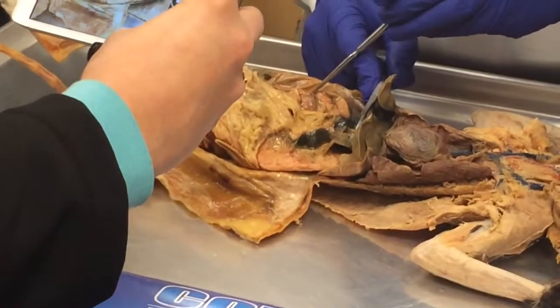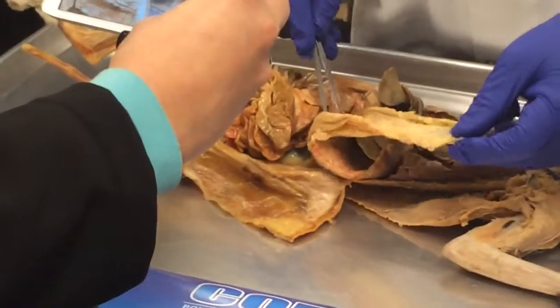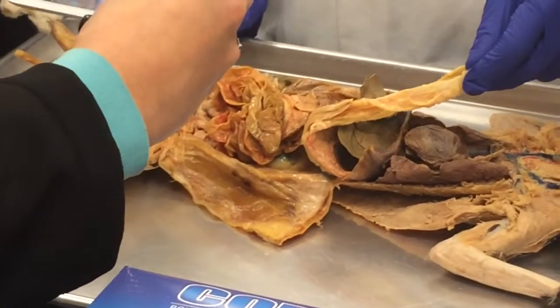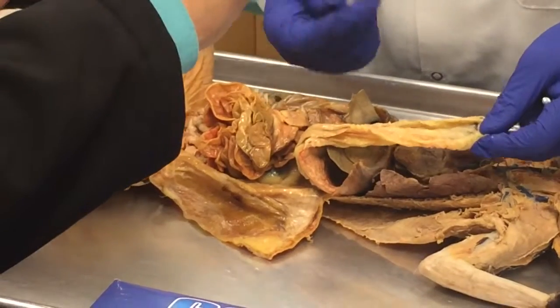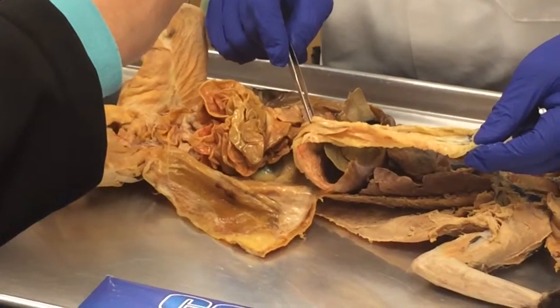And in the quiz, I asked, what's that organ that runs by the duodenum and goes all the way across and ends by the spleen? Pancreas, yeah. People don't realize how big it is. This is the spleen. Do you see that, ladies and gents? And this is the pancreas that ends right there. This is the last part of the pancreas.